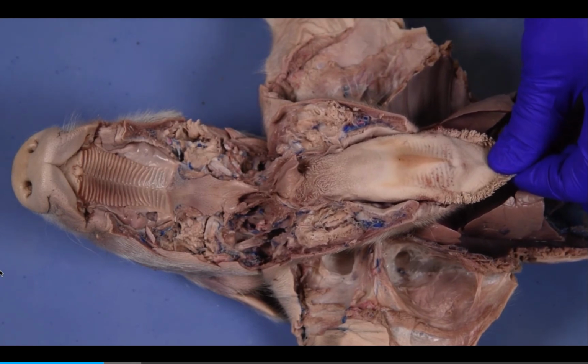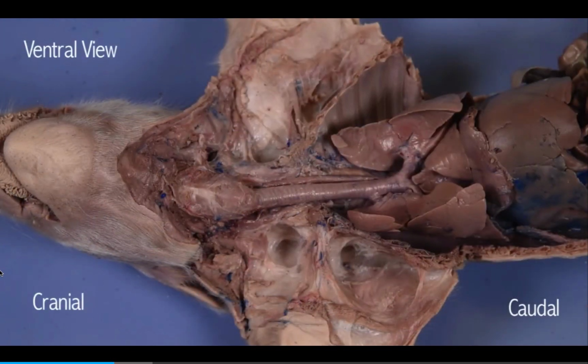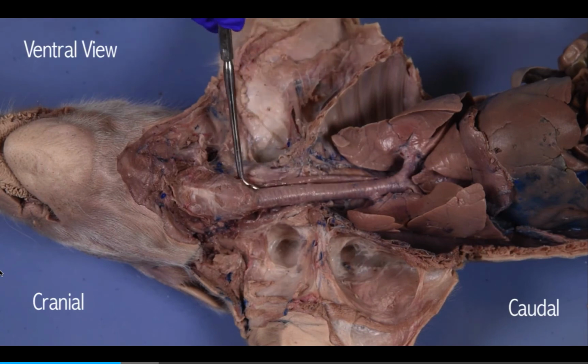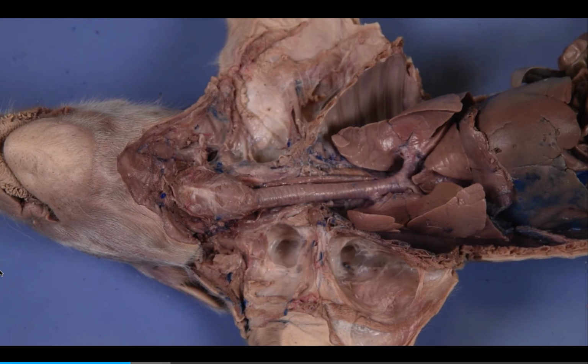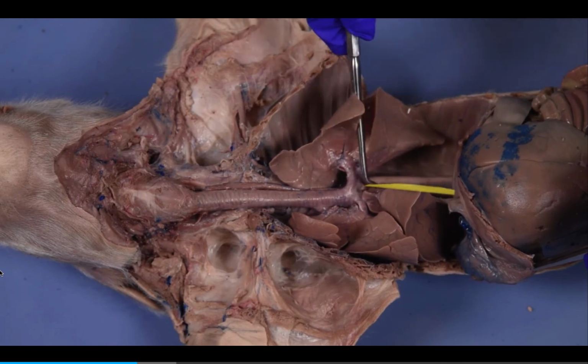When swallowing, the epiglottis closes the respiratory passages. Food moves through the oropharynx to the esophagus, which is posterior to the larynx and trachea. These are respiratory structures and are identified here for clarity. The esophagus travels through the thoracic cavity and penetrates the diaphragm.